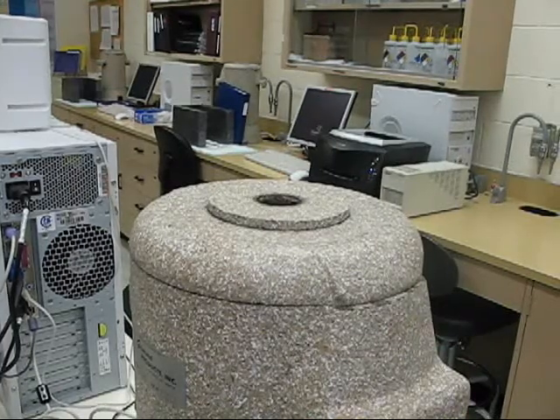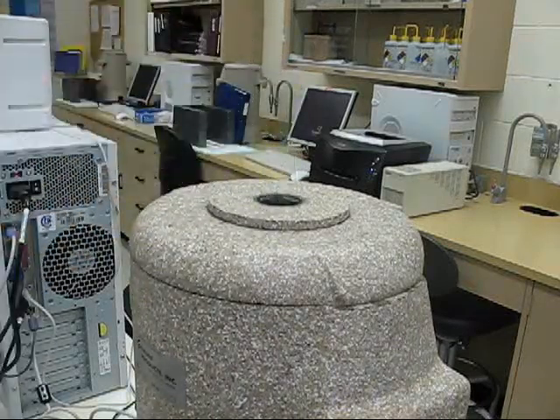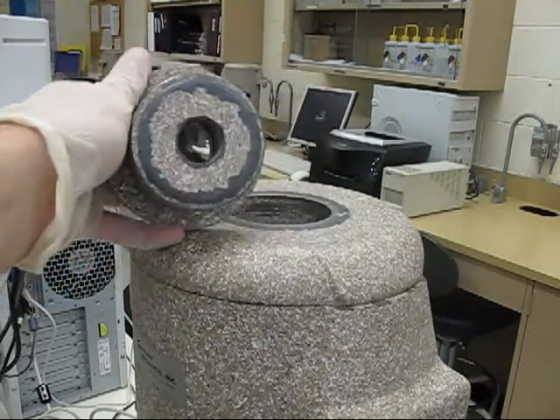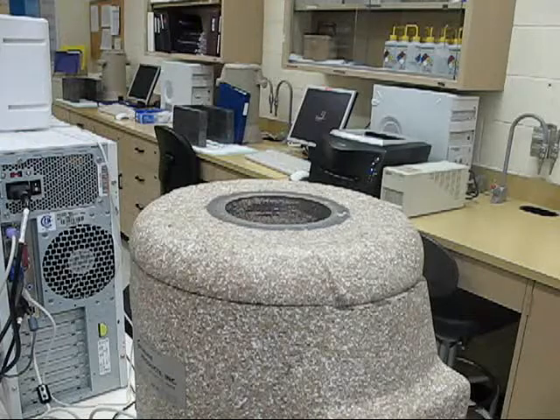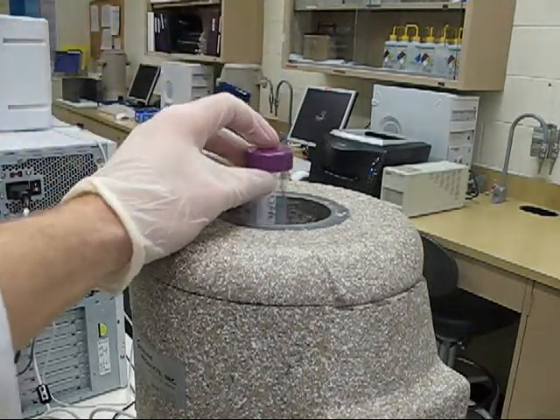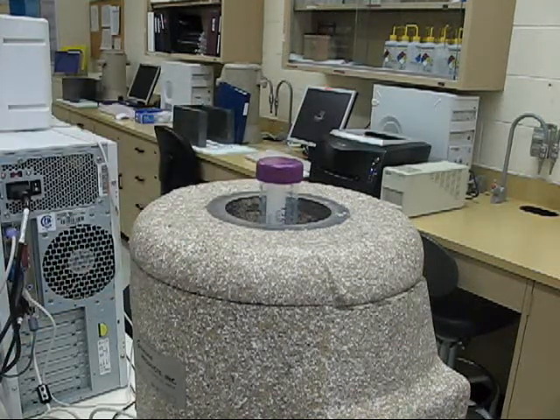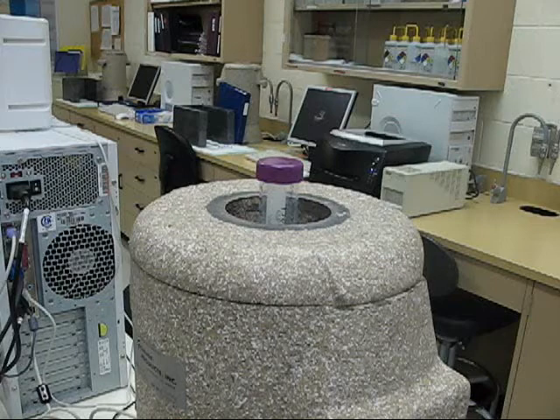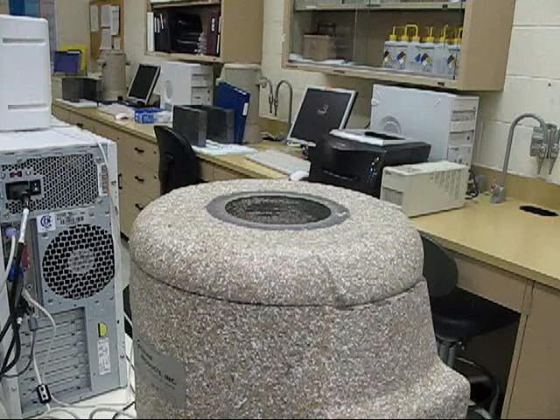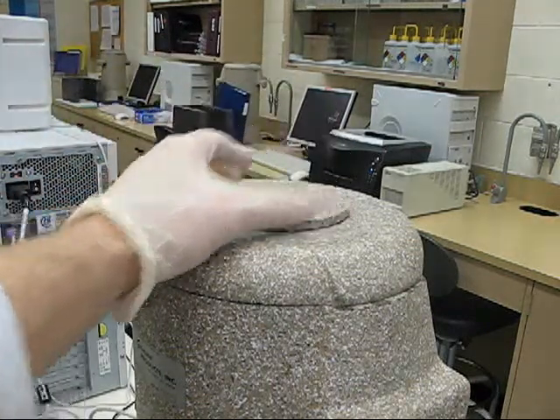When you place your tubes into the MCA, you'll notice it doesn't fit all the way down. What you'll have to do is pull the metal lining from the MCA so that your tube fits directly down onto the well counter. Sit it so that it's nice and straight — it'll bounce — and then you can start your count. When all four counts are completed, be sure to put the lead lining back into the MCA.